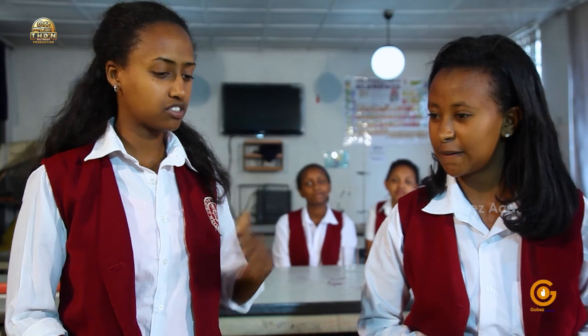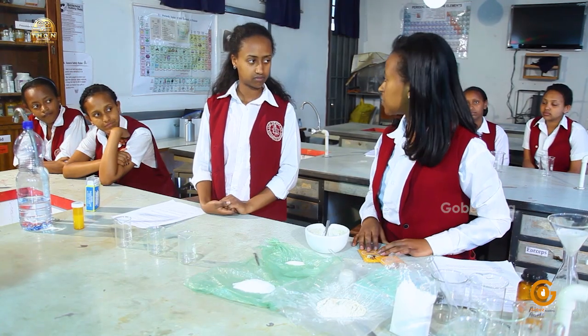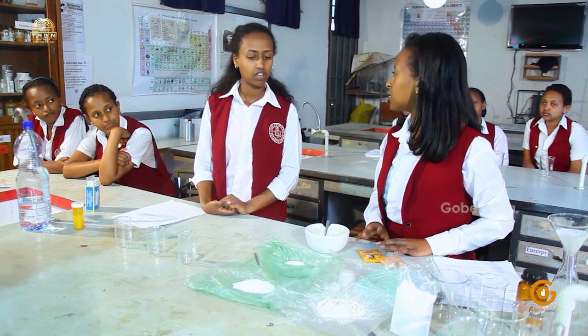Okay. Hello, Liu. Hello, Radit. What are we going to do today? Doctor has already explained the materials that we are going to use for our experiment, but to remind and to be specific, what do we have here? Today we're performing experiments regarding the solubility of substances, what affects them, that is the factor, which can be temperature, surface area, or using a stirrer. That's what we're going to do.